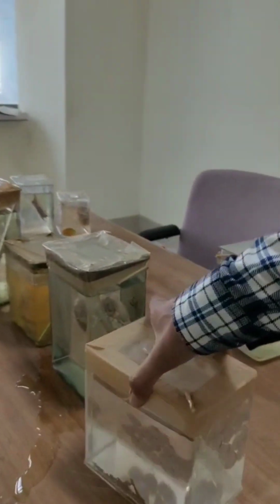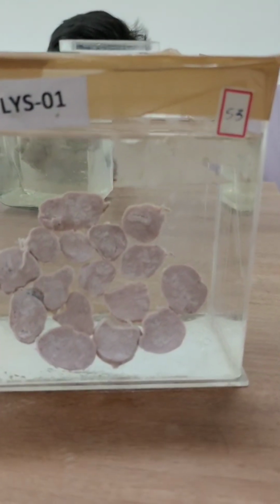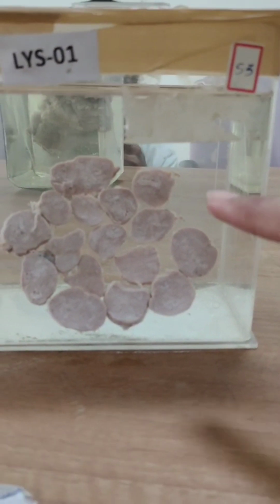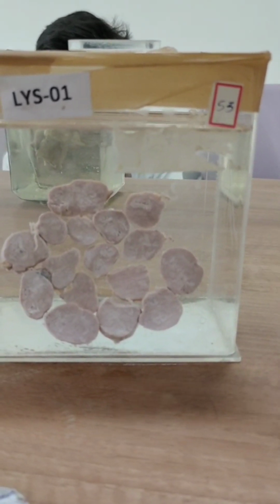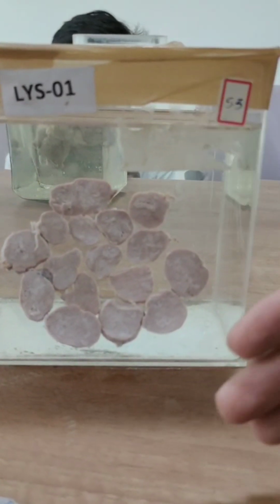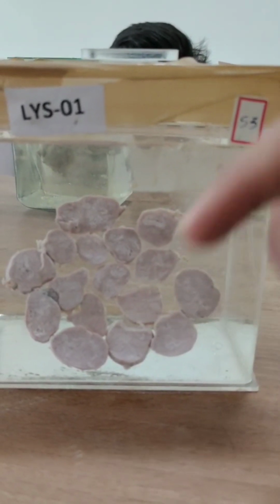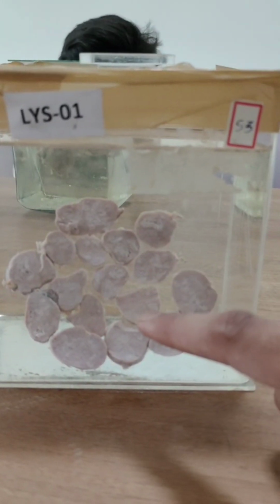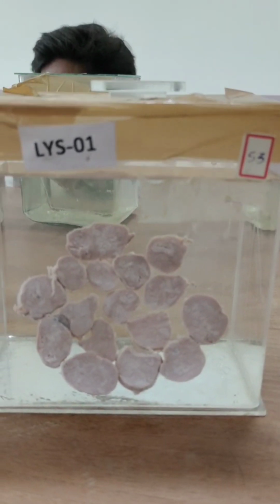So moving on to the next specimen. Here you can see these are multiple. Here is a glass jar containing multiple cut sections. Okay, so this is actually I know the answer. This is nothing but a cut section of lymph nodes. Not TB also. How can we identify? You can tell these are capsule-like structures with outer cortex, inner medulla, and bean shaped. So by this we can tell these are the cut sections of the lymph nodes.